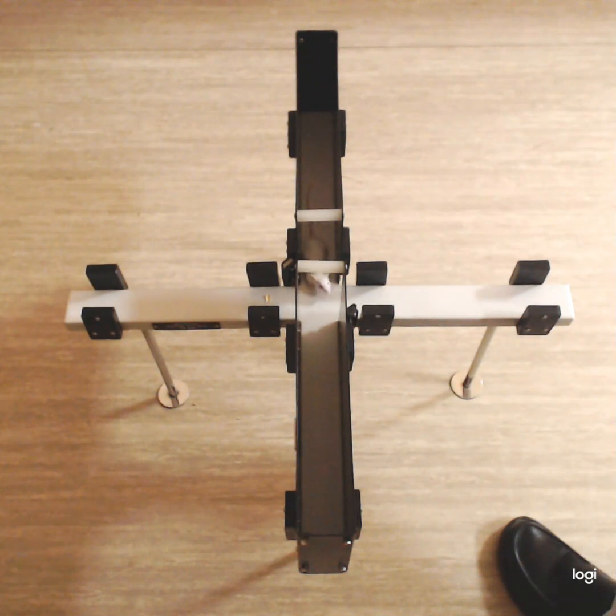So fear due to any harm or danger will lead to anxiety. As you can see, slowly it is trying to explore the open arm. You can see some head dips. This is vertical rearing, you can say, standing on hind limbs and exploring the apparatus.